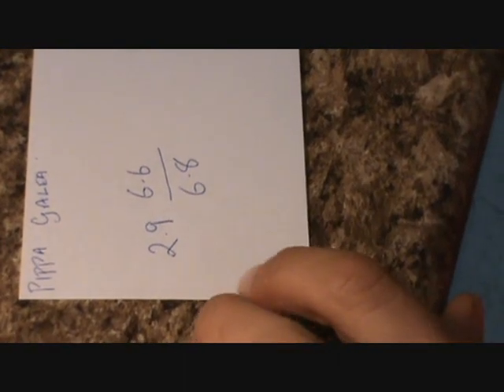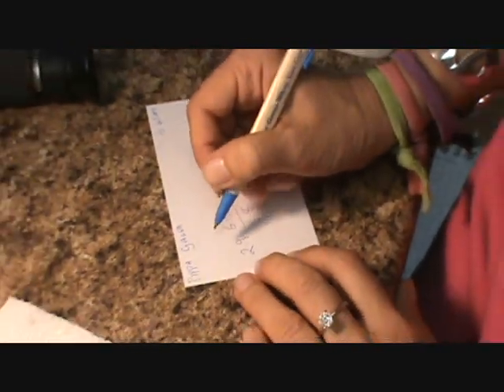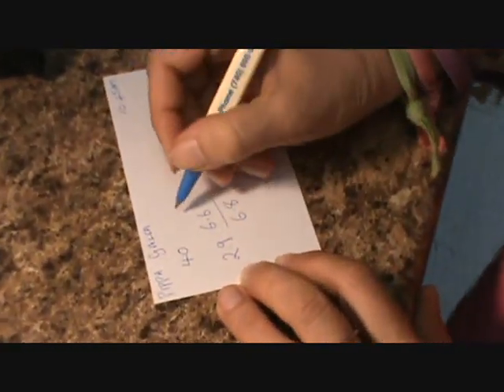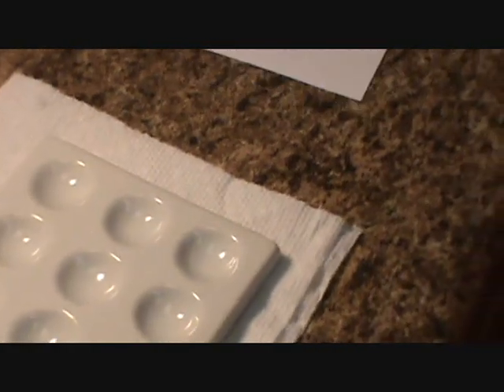So eventually we'll have 7 numbers on this card. The time of the test is really important — this was urinated at 10:45 am. The best time to do the test is between 11 and 12, so I'm running it a little bit early. And then it's your age — 40. And how tall you are, which is 5 foot 7. And your weight, which is around 135 pounds yesterday, so... I think the scale's off here though. She's not a pound over 120.